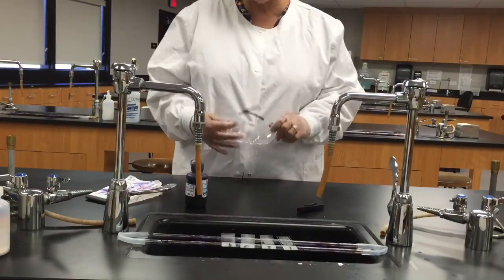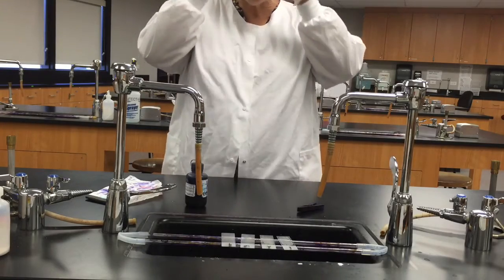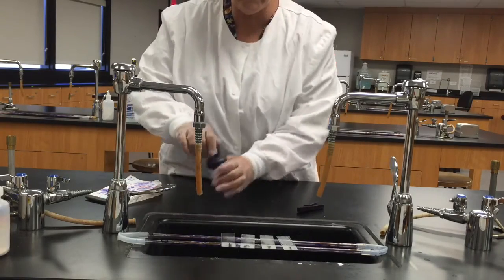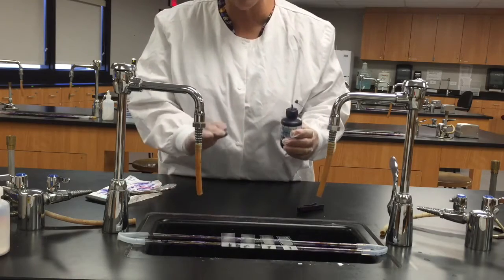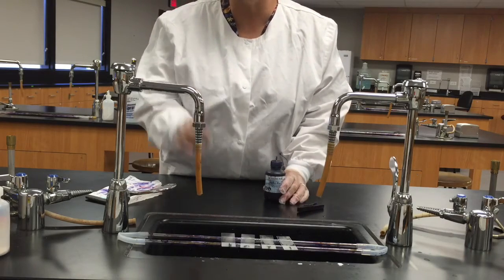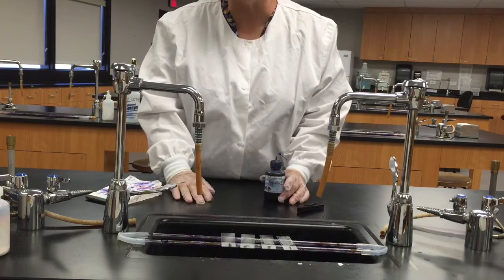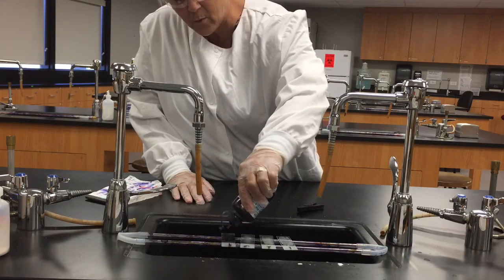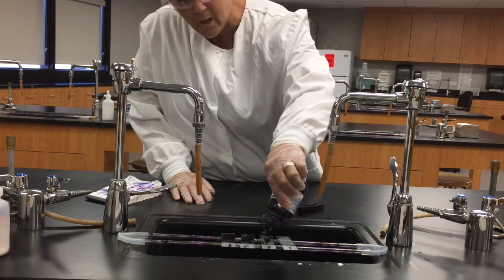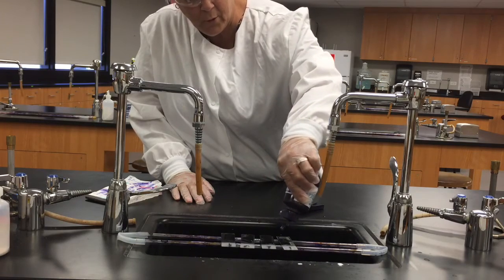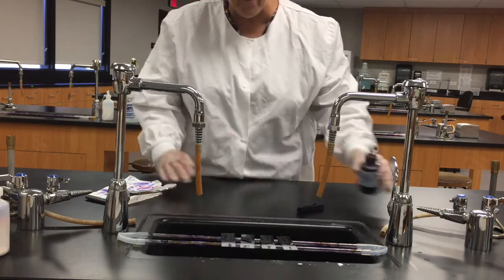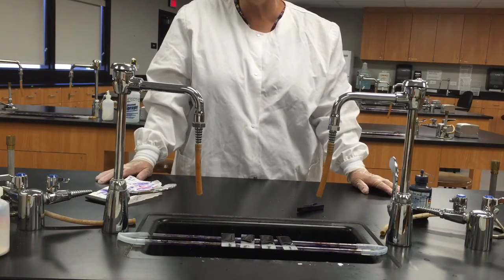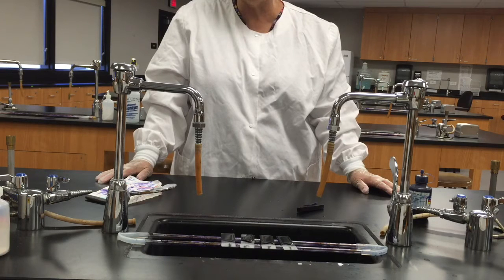Okay students, I've got my air-dried heat-fix smears ready to stain. I'm going to put my very stylish protective eye gear on. And what I'm going to do for this technique, this is just a simple stain, just staining the cells to provide contrast to make it easier to visualize them when we get ready to put these slides on the microscope. I'm going to cover the slides with methylene blue, and I'm going to leave the methylene blue on here for about a minute, so I need to be a little patient. I will try to fast-forward this part of the video when I edit it, but we'll see what happens.